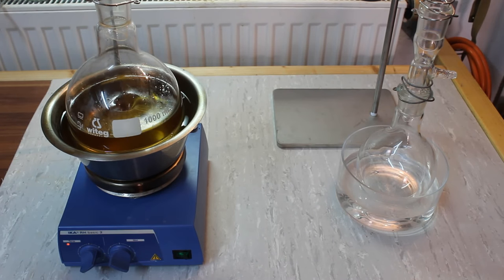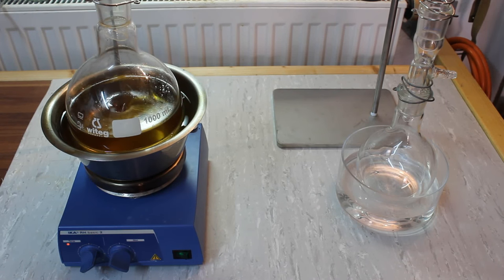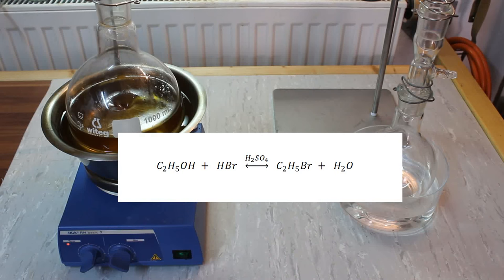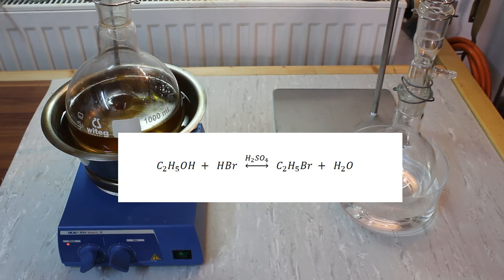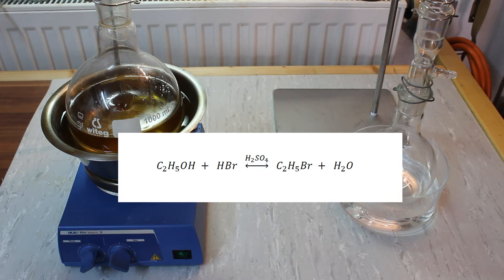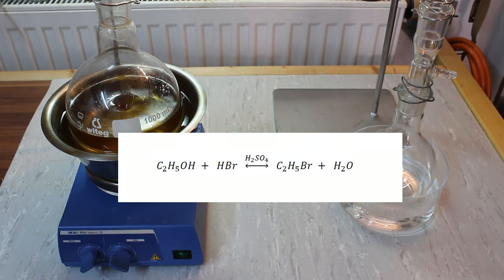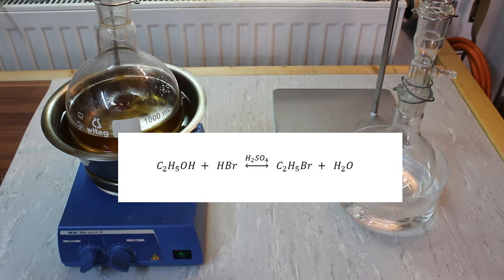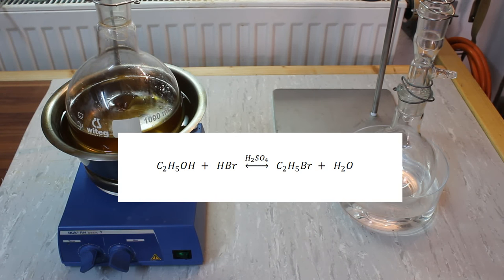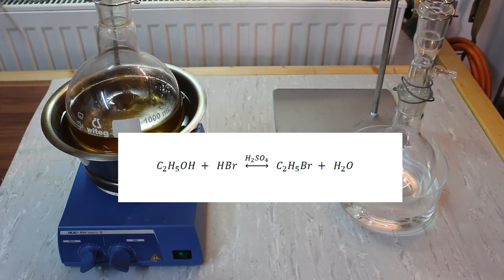I've turned on the heating so while everything slowly warms up let's talk about what's actually happening here. The formation of bromoethane is a classical equilibrium, meaning that to drive the reaction to completion we have to either add some educts or remove products. In our case bromoethane conveniently has the lowest boiling point of the mixture, so we can distill off all of our product, thus driving the whole reaction to completion.